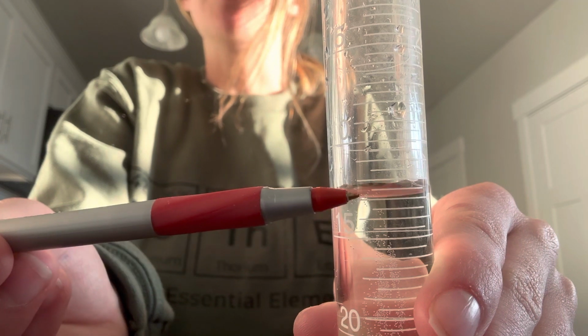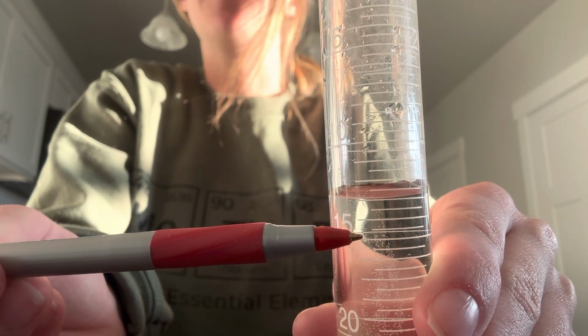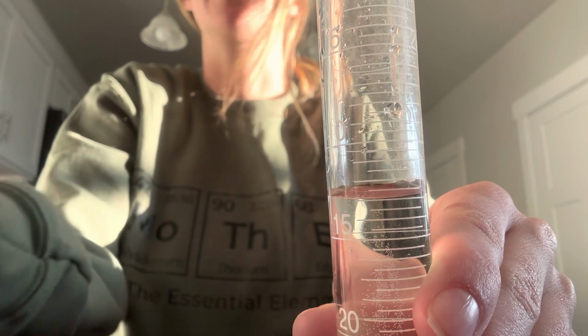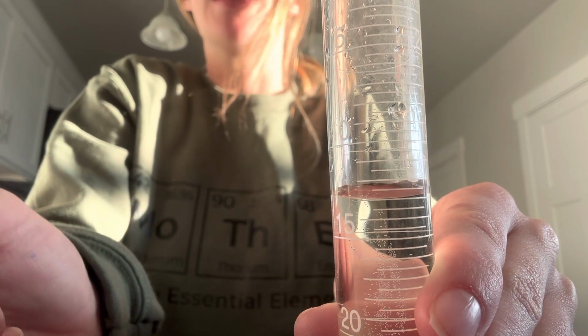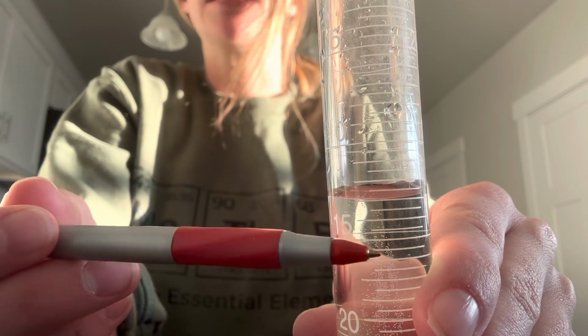So you'll notice to read this one, it's right here at this big mark. All right, so we know that if this is 15, 16, 17, this would be 17 milliliters if I were to read this. So make sure you read from the bottom of the water, and then make sure you count your marks correctly.